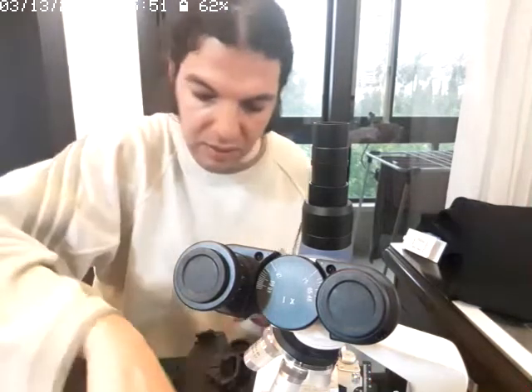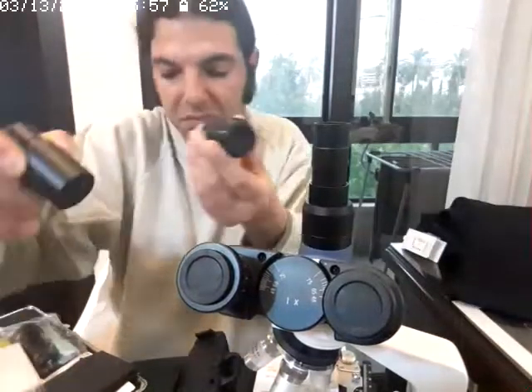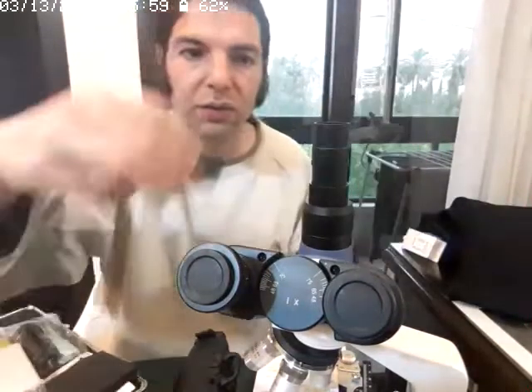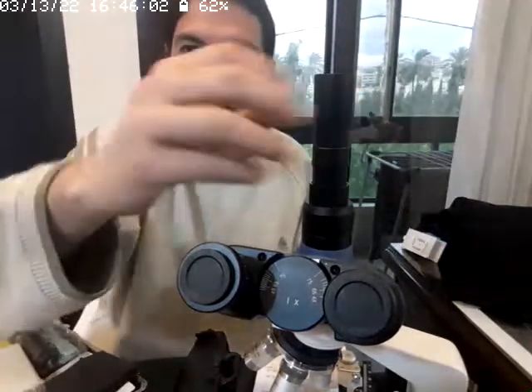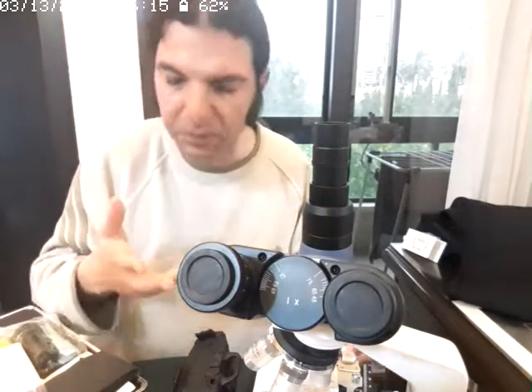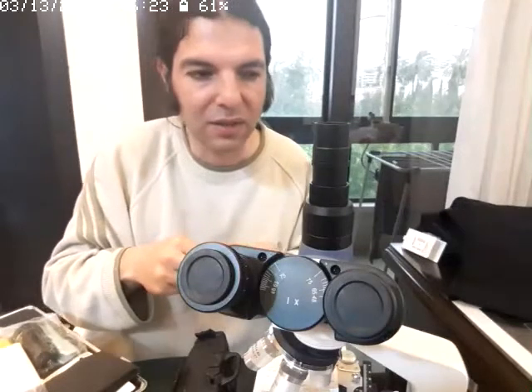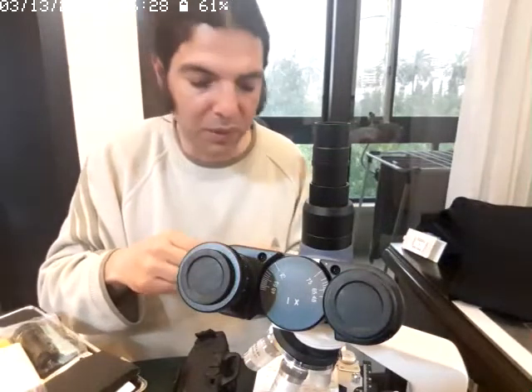As you can see, there's a difference. This is smaller than this. Of course, I know here you'll have to use only the 23 millimeters, but with the adapter at least you get eye relief. And because I have loads, why should I buy more? It's just a matter of thinking. Although I thought those should be for the microscope when I first started, because I was a little ignorant about such stuff. Later I learned, then I started testing, and then I knew how things are.